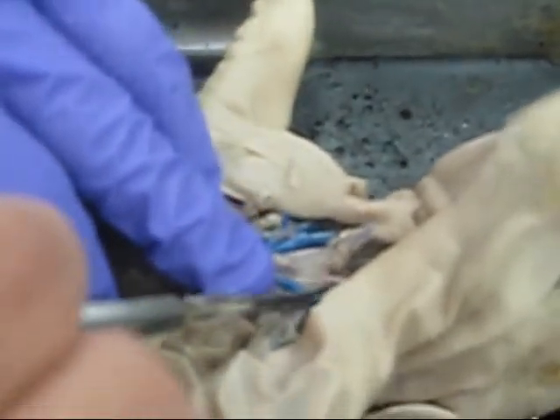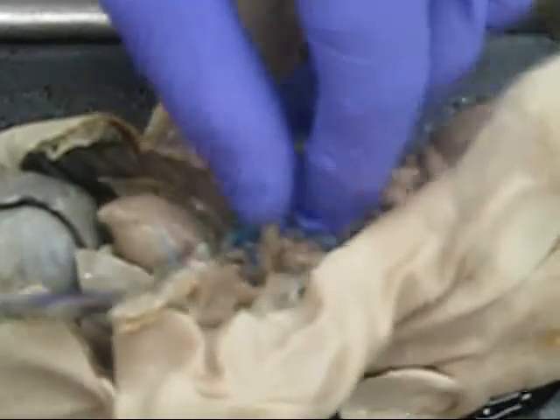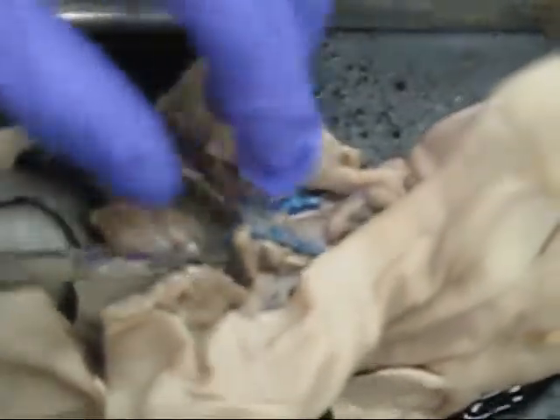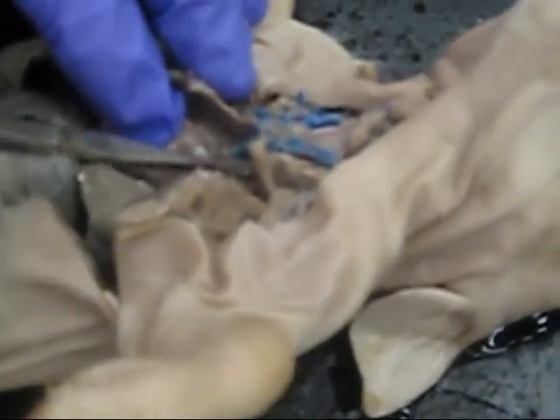All right, this is the right carotid artery, right there on the right side of the larynx. It's the left carotid artery, opposite. The bicarotid trunk is underneath this vein. I can't get at it. It's the big red tissue under the vein, and it comes out of the aorta. It branches off the aorta.